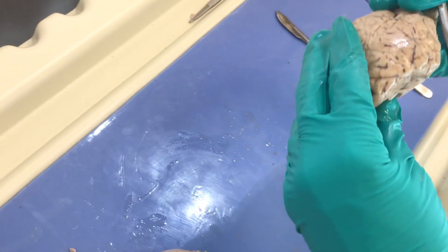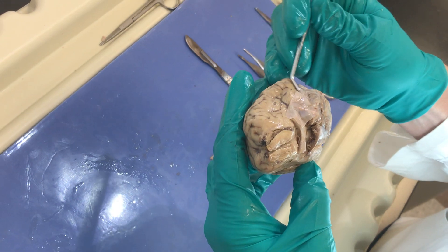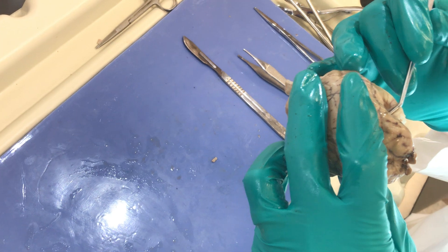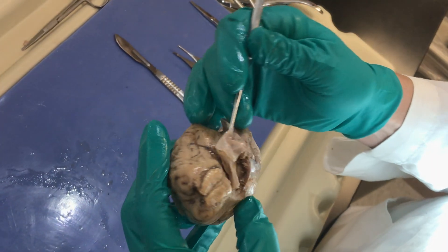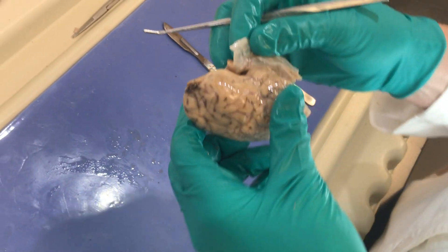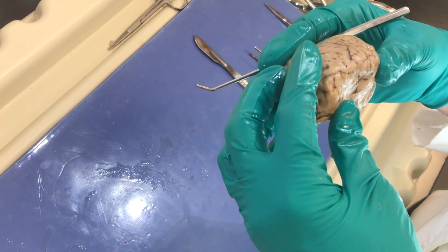If we turn this brain section and look at the ventral aspect, you can see the dura but most of it has been removed. As you pull this away, if you start to see little fibers tearing, that's gonna be your arachnoid mater. Just appreciate that these are protective coverings for the brain and help reduce friction and trauma to the brain tissue itself.